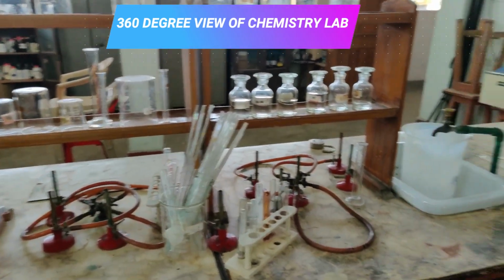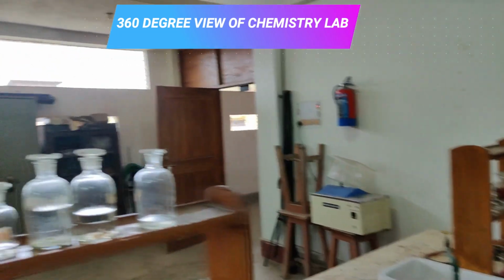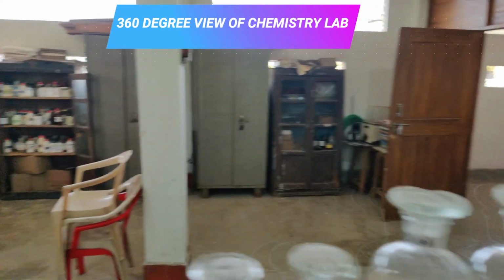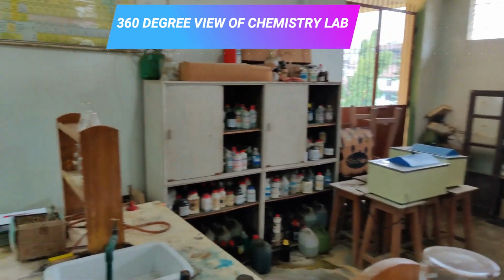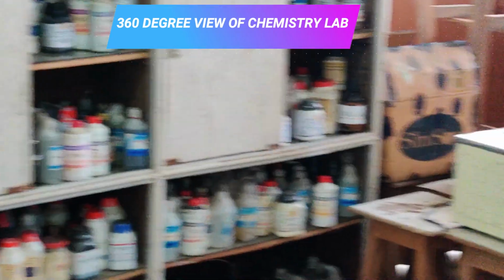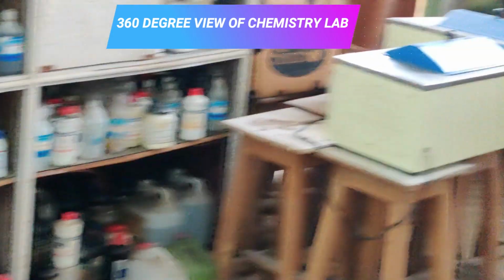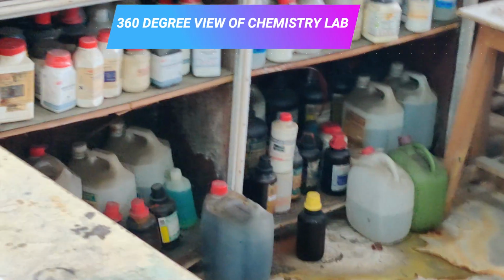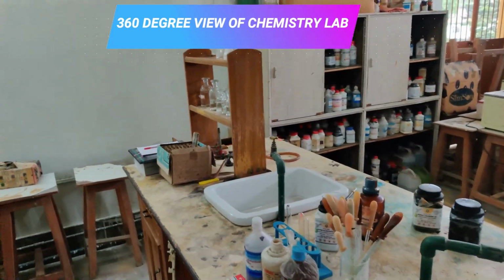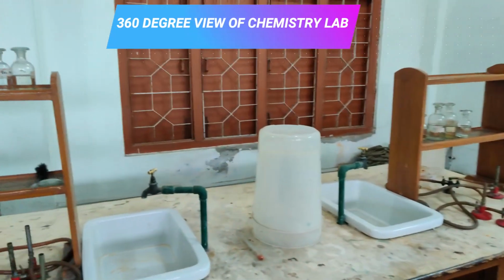So this is a 360-degree view of our chemistry lab. There you can see the water bath that we use for other practicals. Then you may see we have some reagent bottles there, chemicals. In the rack there, these are chemicals that we will be using. In fact, I have procured those chemicals from those racks and those almirahs, and I am going to have some more water baths, chemicals, acids, you can see on the lower part. And this is the chemical I am going to use for doing the practical today. Yeah, so now we will start with our practical.